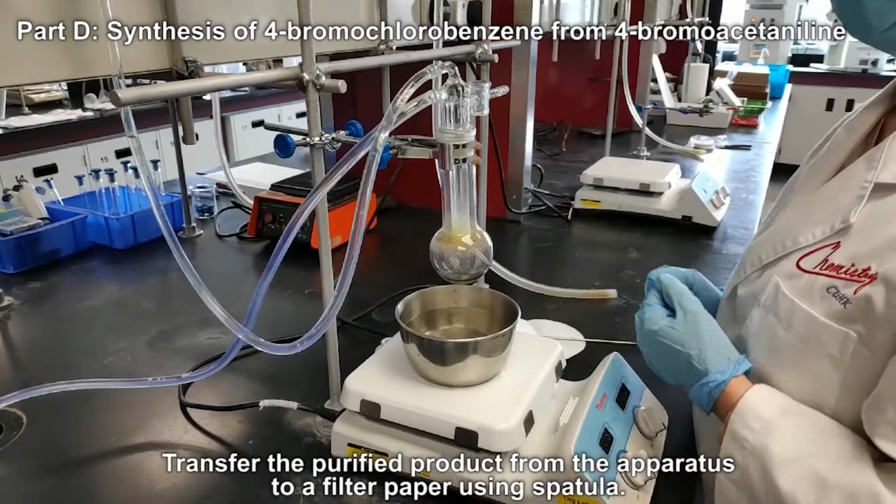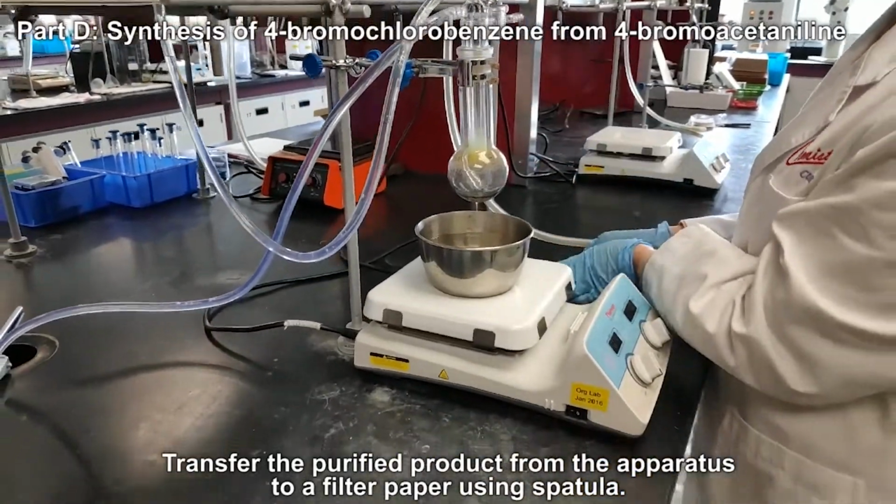Transfer the purified product from the apparatus to a filter paper using a spatula.